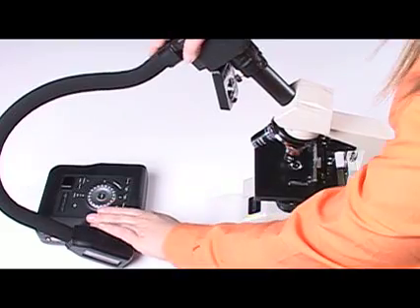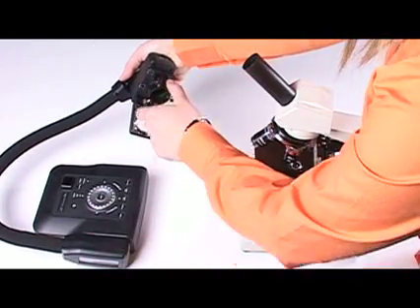To remove the adapter, simply press the latch at the top and pull.